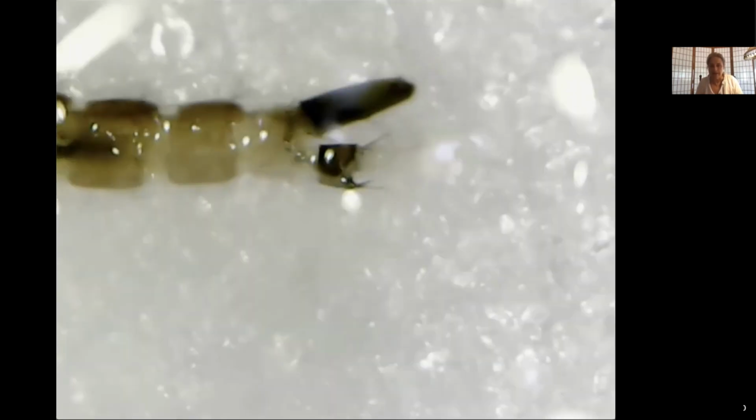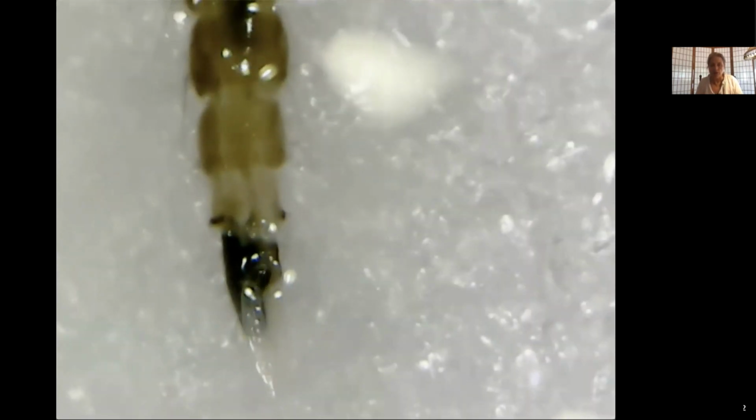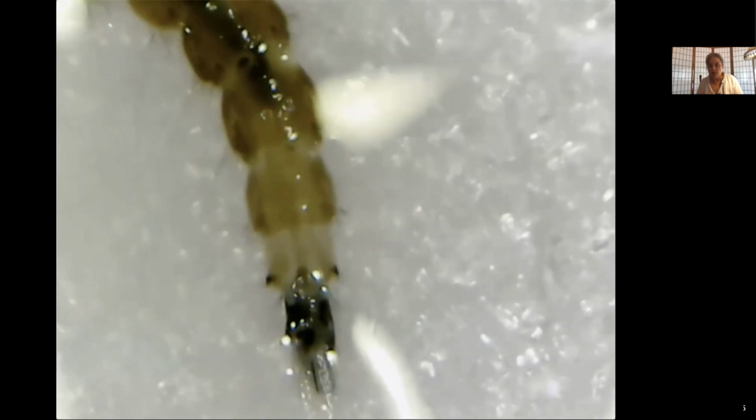features on that siphon. Now we're going to try and look at some of the characteristic morphological attributes on that siphon to tell us what we have. So I am going to focus in just a little bit. Look at that. There we go.